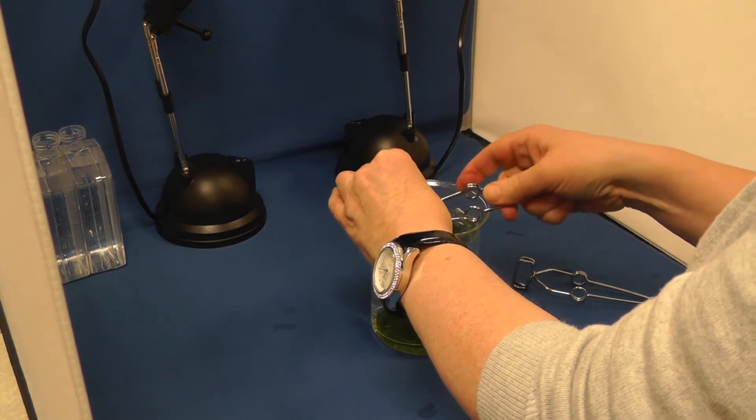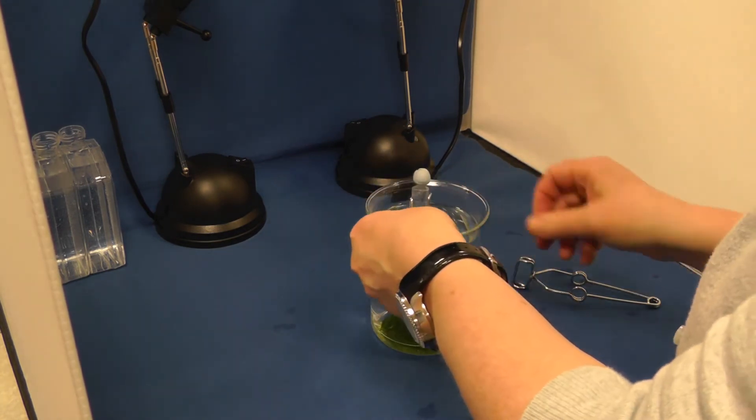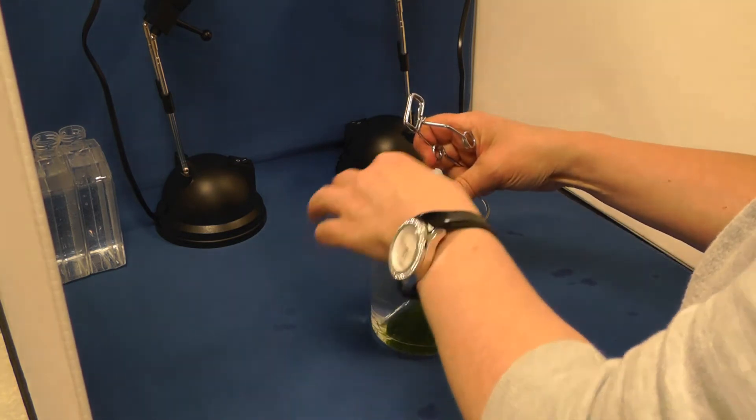Metal test tube holders can be used to keep the syringe in place above the end of the funnel so that the gas produced will displace the liquid.